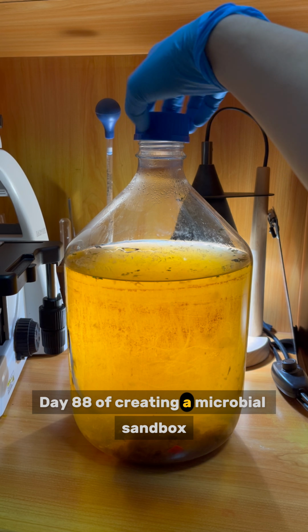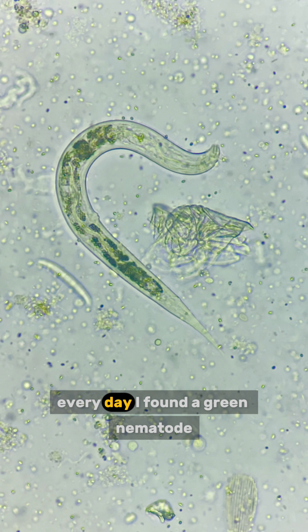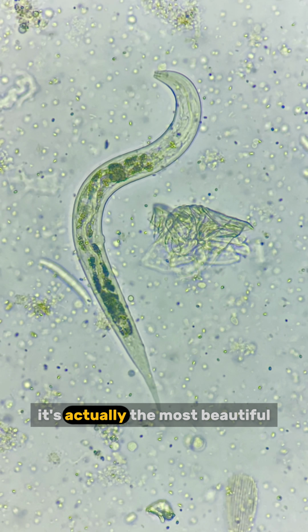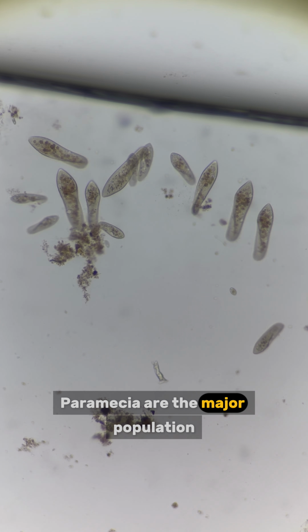Day 88 of creating a microbial sandbox by adding random stuff and observing it under the microscope every day. I found a green nematode. It's actually the most beautiful nematode I've ever seen. As usual, paramecia are the major population.